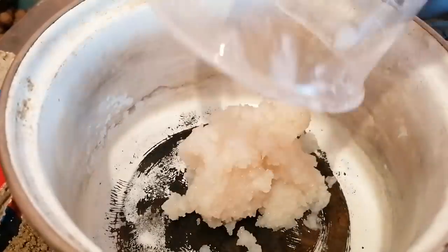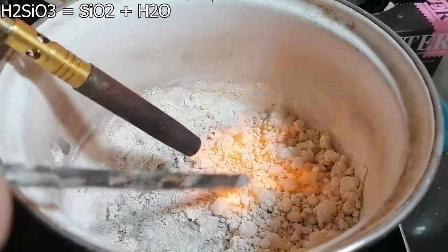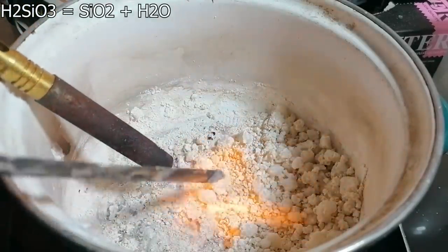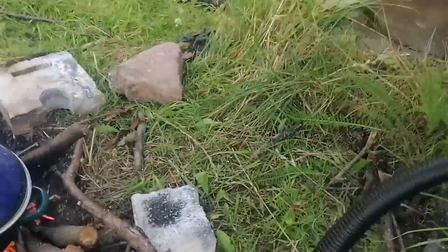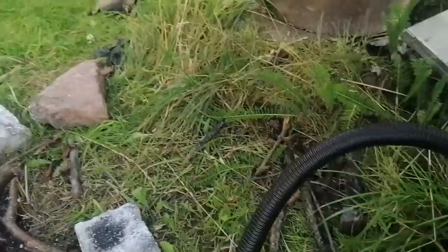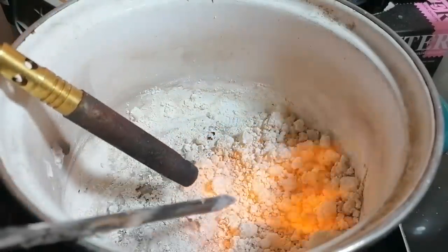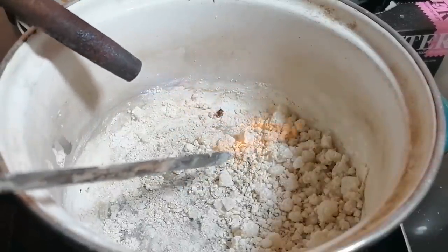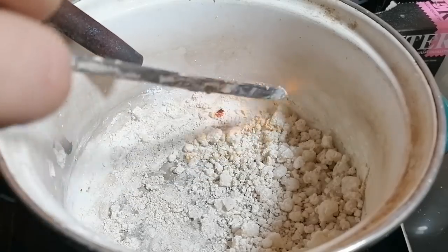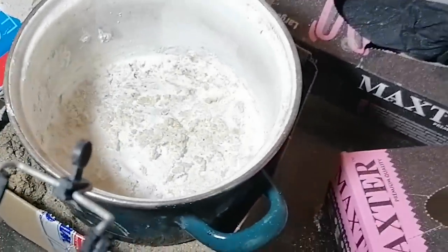I've added a bunch of the silicic acid onto a pan and started heating it. This is the part where it pissed me off — silicic acid decomposes into silicon dioxide at extremely high temperatures, which I had trouble reaching. Eventually I put it onto a campfire and tried the steel-forging method, but sadly my pump decided to break, and I was stuck with blowtorching. This process was extremely unpleasant; in fact, I was blowtorching it for so long that my phone which was recording the footage turned off because of the heat. So there was definitely some conversion, however I'm not very optimistic.